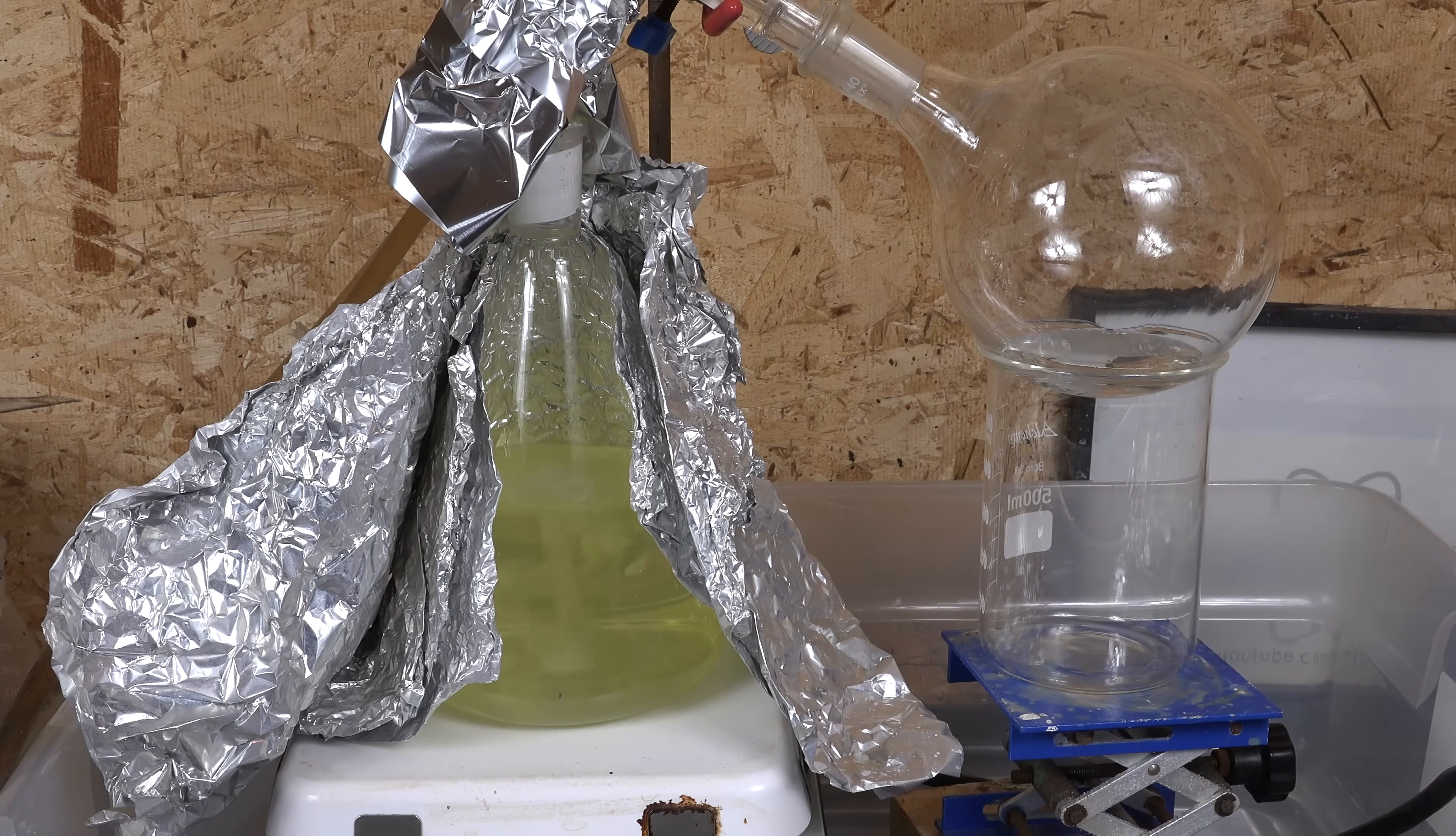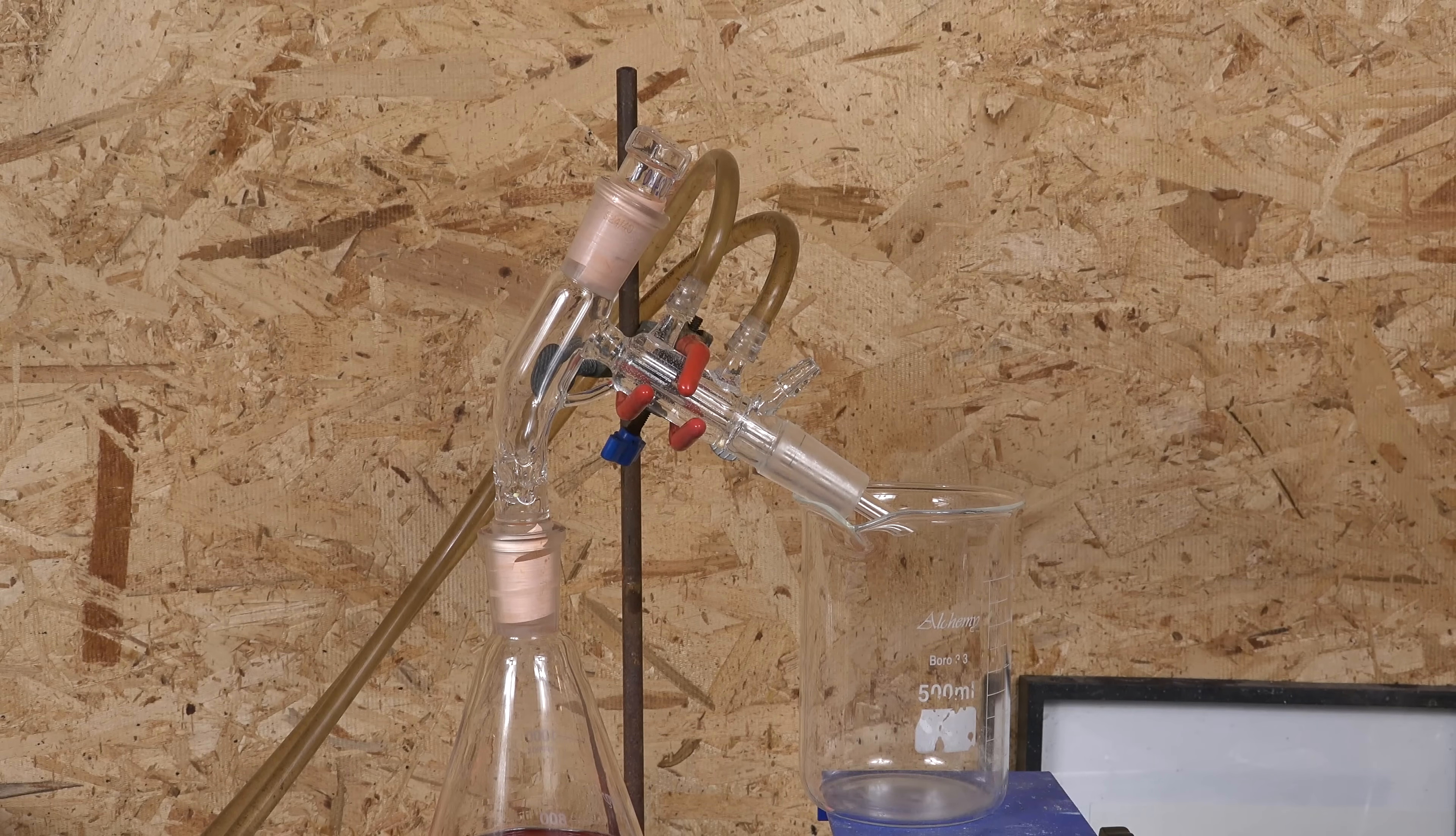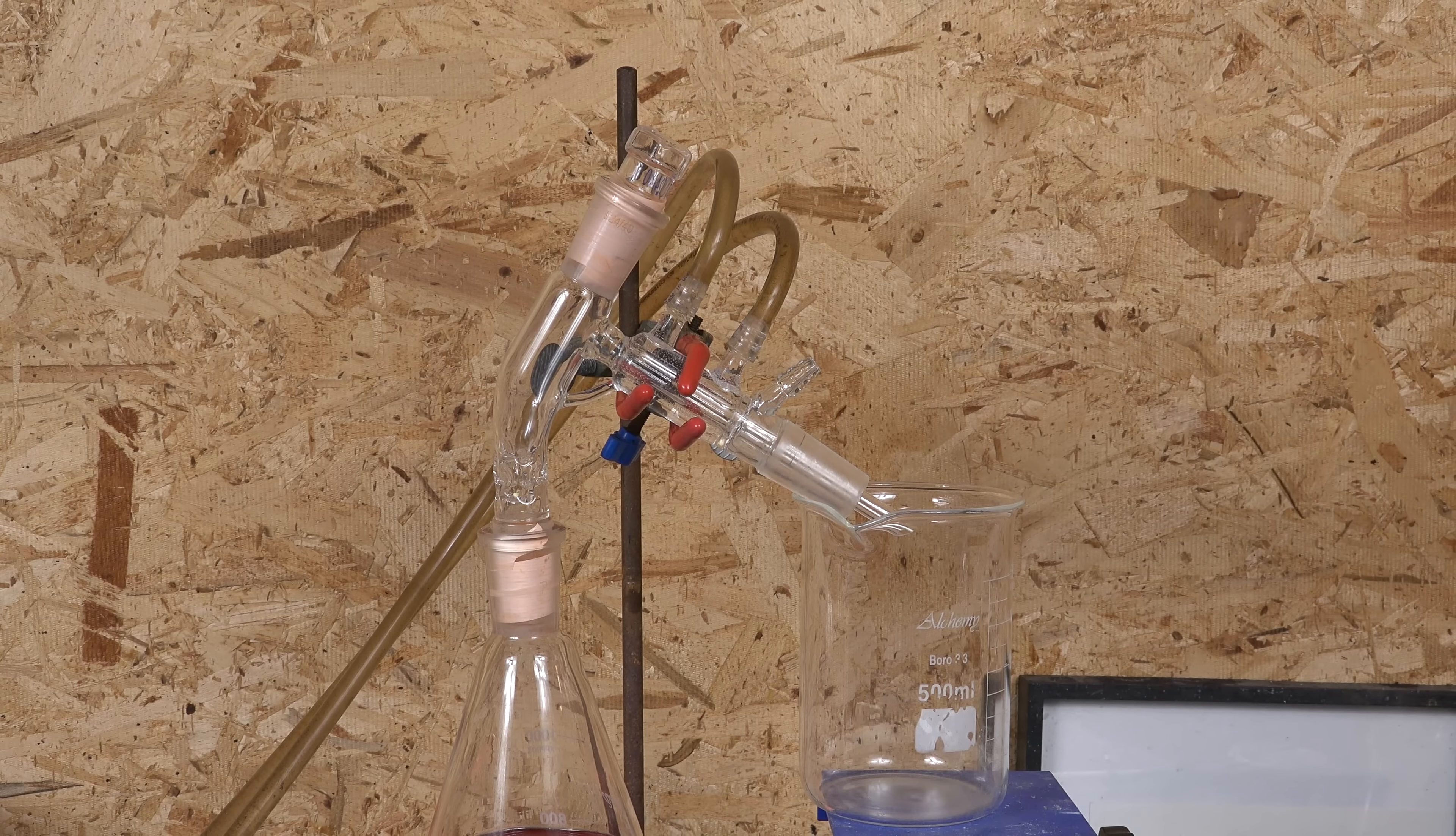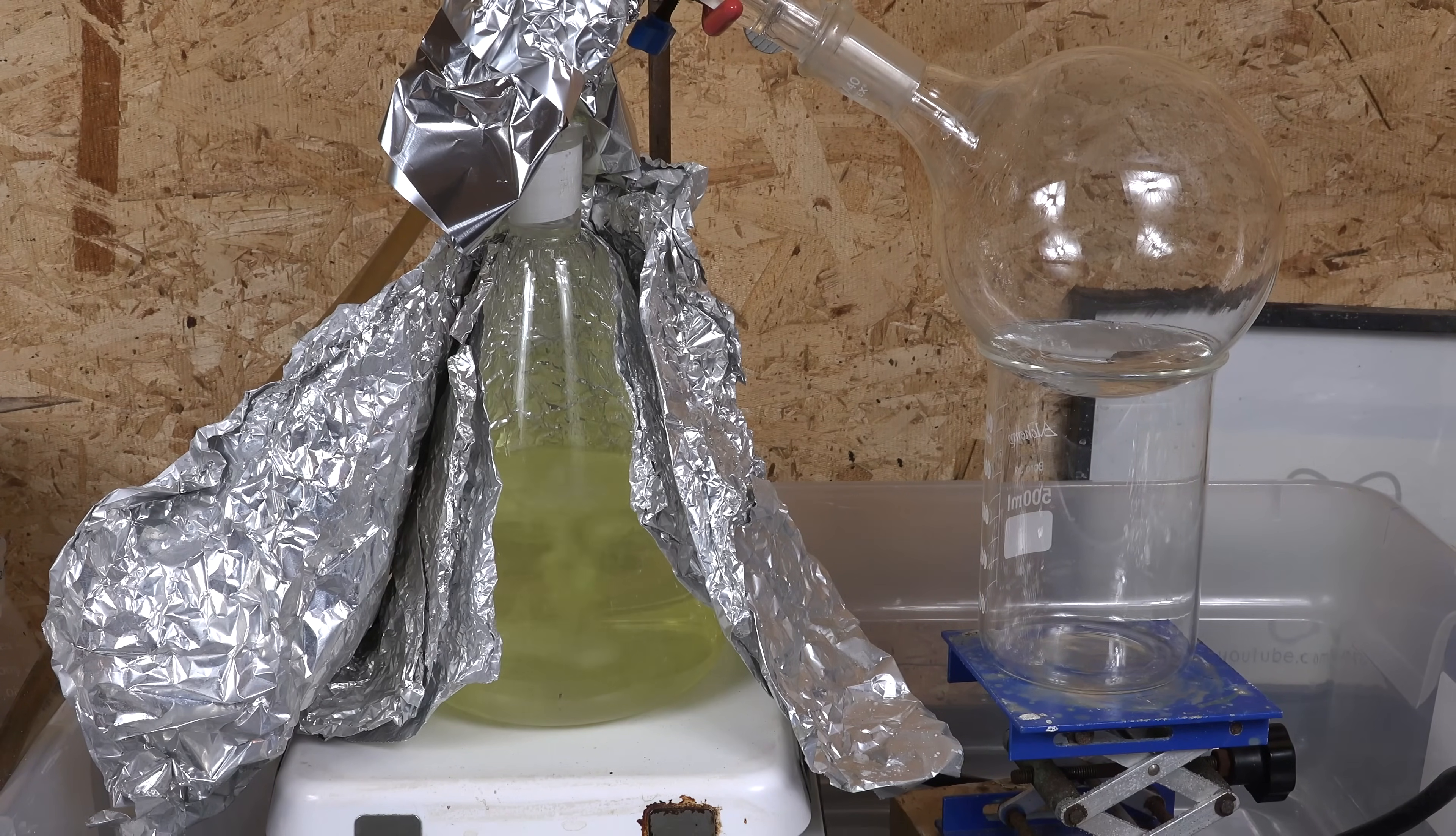And there it goes. As we wait we got time to talk about some background information and extra notes about the process. Something that I should address is my use of cooling water for the condenser. Some amateurs have reported that the glass can crack or even shatter from the thermal stress and instead recommend pumping air through the condenser to provide milder cooling action. I've almost never had a glassware failure so I continue to use cooling water. But if you are uncertain about the quality of your glassware then forced air cooling should be considered.